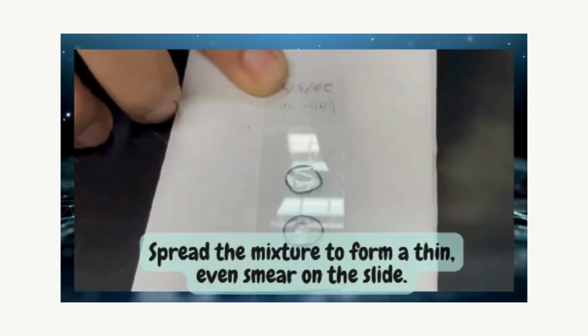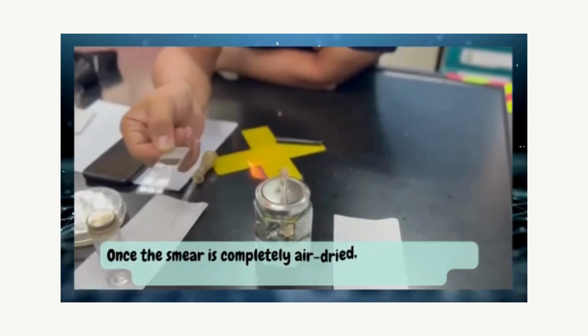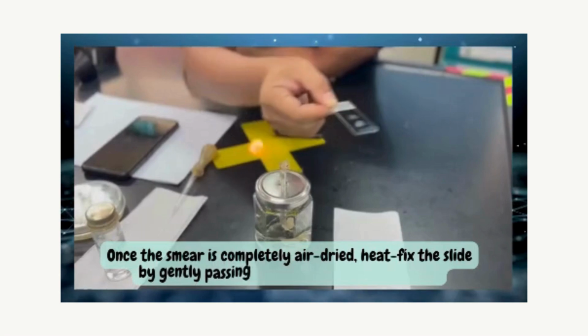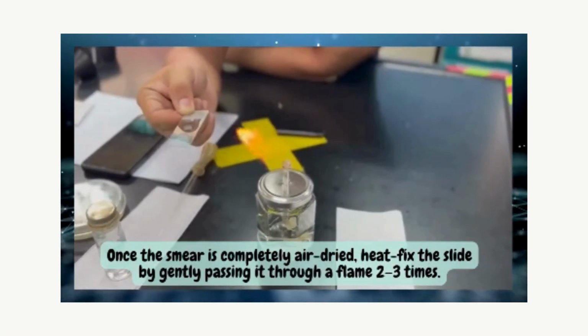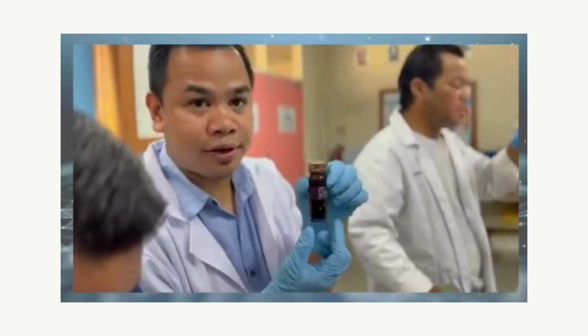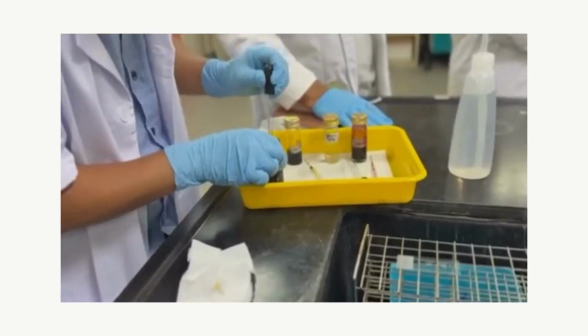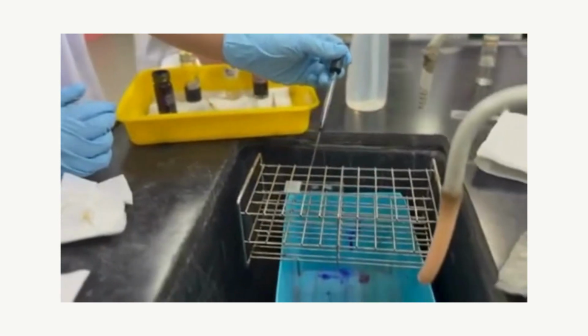Spread the mixture to form a thin, even smear on the slide. Once the smear is completely air-dried, heat fix the slide by gently passing it through a flame 2 to 3 times. Crystal violet was put on and kept for about 30 seconds to 1 minute.